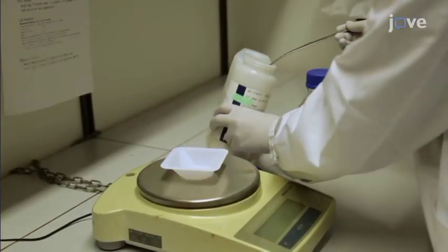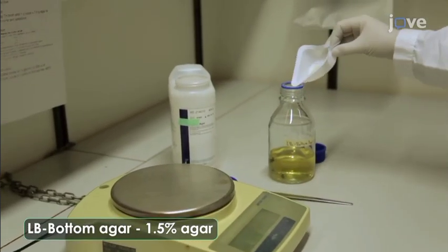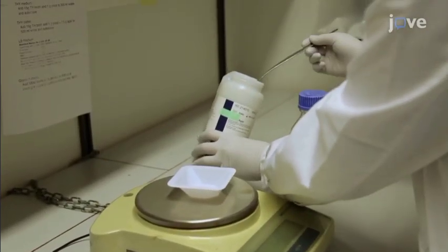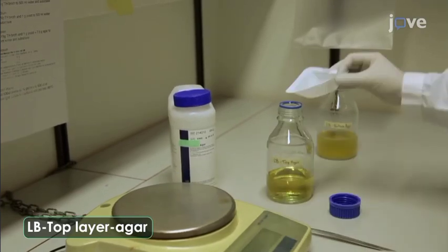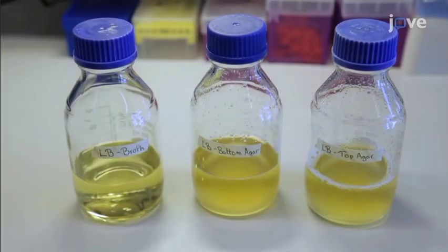Now weigh out 3 grams of agar powder and add it to the second bottle to make a 1.5% bottom agar. Finally, weigh 1.2 grams of agar and add it to the third bottle to make the 0.6% LB top agar. The broth condition in bottle 1 does not need an agar addition.